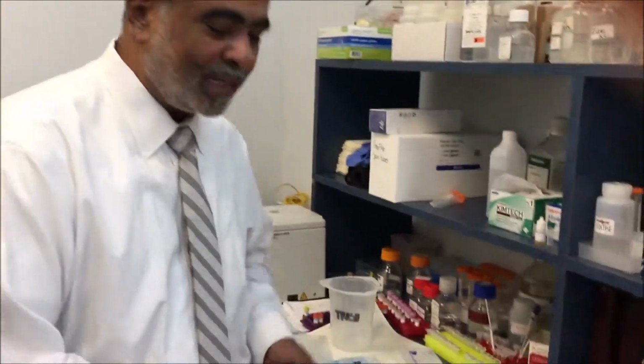The main feature of the Omni-Matrix as opposed to the swab is in the application with trace amounts of DNA sample or trace amounts of biological fluid. When we are talking about trace amounts, we are usually talking about a fingerprint, or hardly any biological fluid. It has been documented that about 30 to 80% of the sample is actually lost in the collection procedure, and then another 20% is lost during the processing.